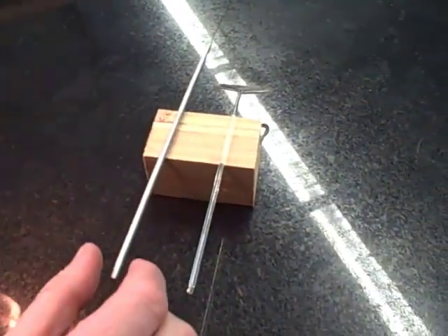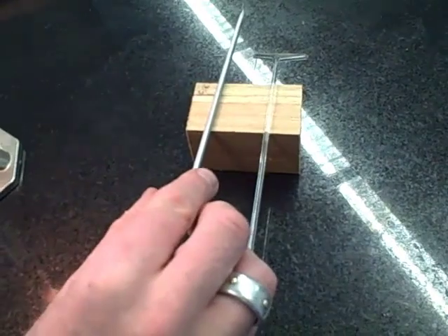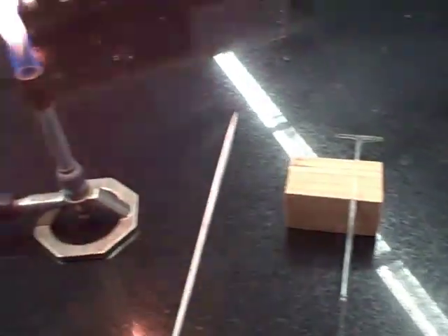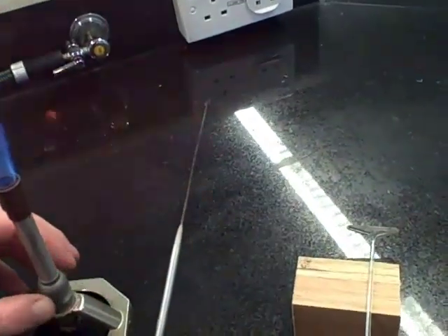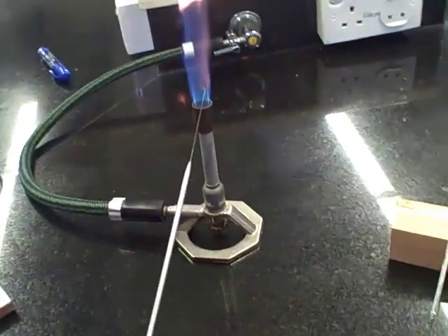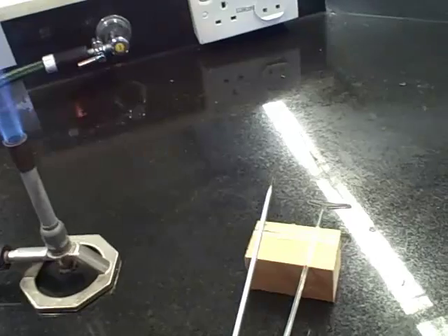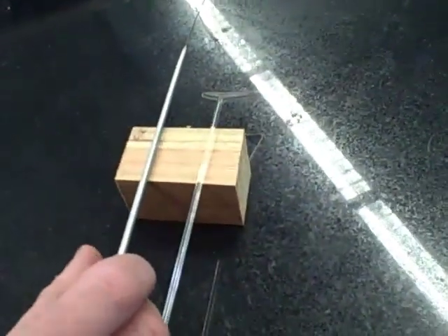What you need to do this is a loop, a spreader, and a very high technology wooden block. Before we can start we have to make sure these are sterile, so that we don't have any other bacteria affecting. So very quickly we heat it up just on the edge of the blue flame. That's it — fully sterile. We can't blow on it; we've got to try and keep it sterile. Hence the high technology wooden block.